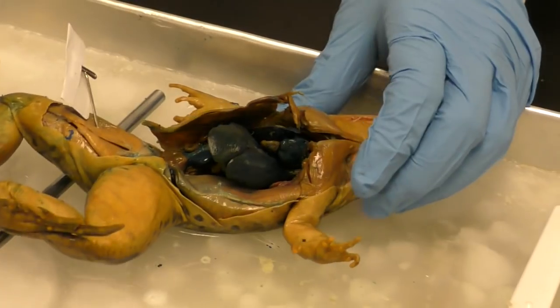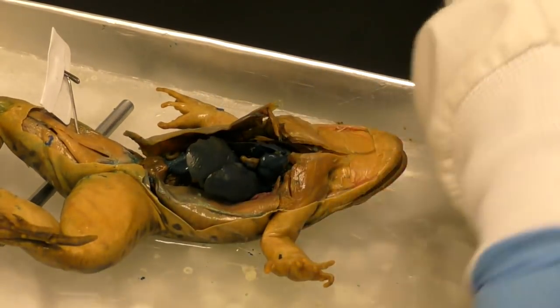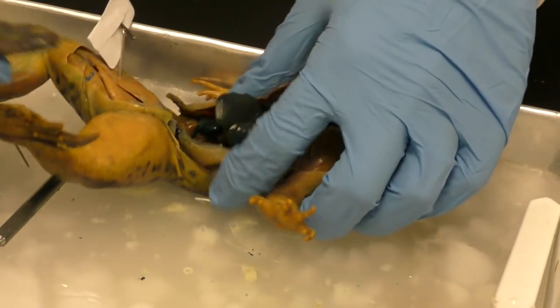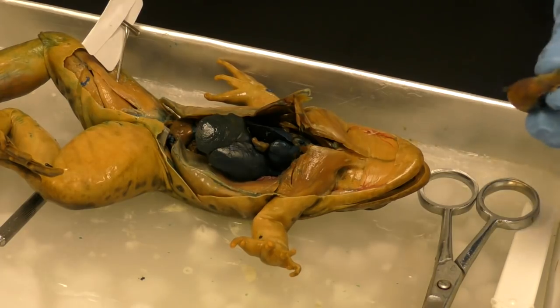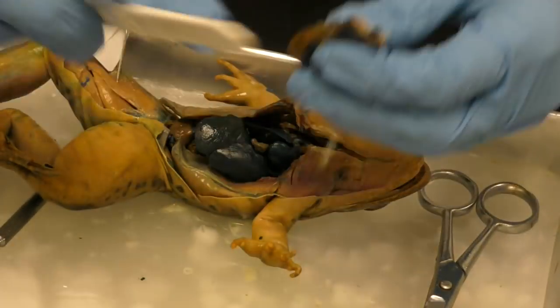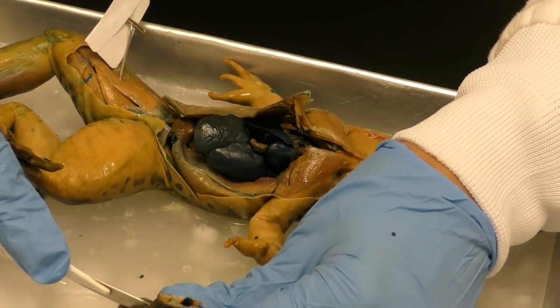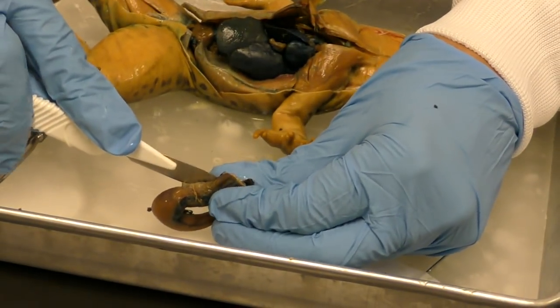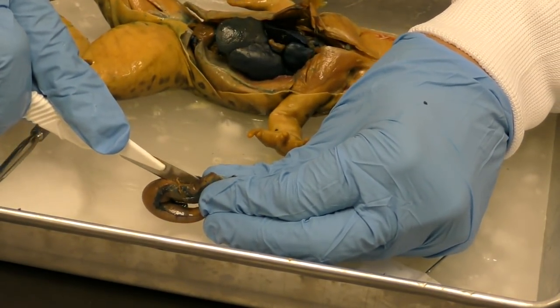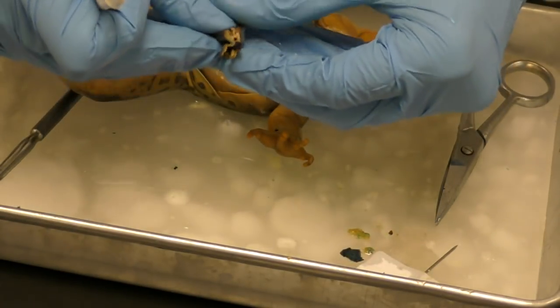There we go. Okay, so you guys can't see me now, but I am wearing a lab coat and goggles because I tend to be very messy when I do this, and the juices are flying. Okay, and it's not frog juices, it's preservative, and so that would be bad to get sprayed in your eye. All right, I am cutting open the frog's stomach.